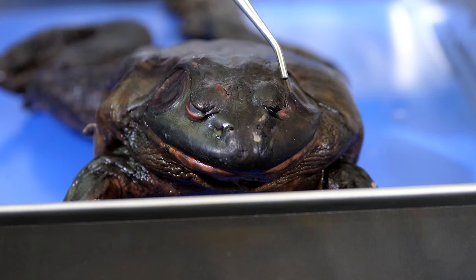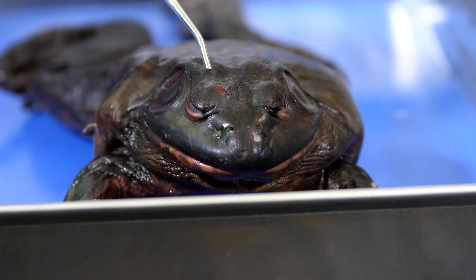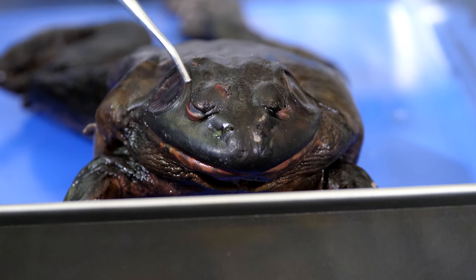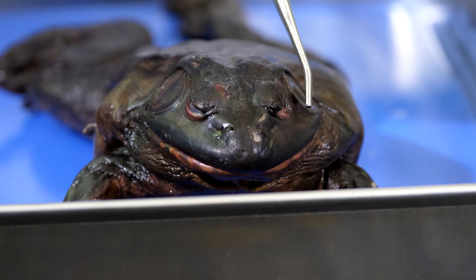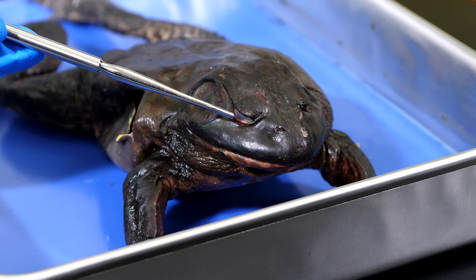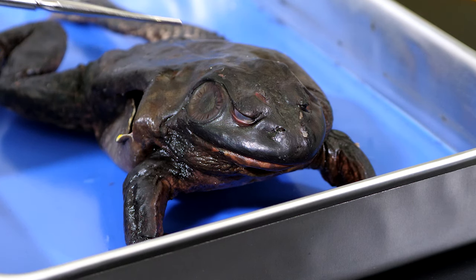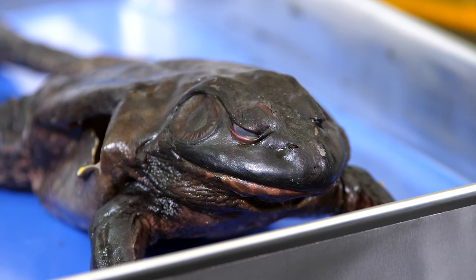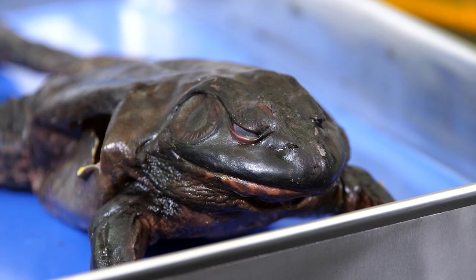A frog has two large, bulging eyes. It is interesting to note that the frog has three eyelids. One pair of eyelids open and close to protect the frog's eyes while the amphibian is on land. The frog's third eyelid is a transparent membrane that protects the eyes while the frog is swimming underwater. Sometimes the third eyelid becomes cloudy when the frog is prepared for dissection, which is why we cannot clearly see the features of its eyes.